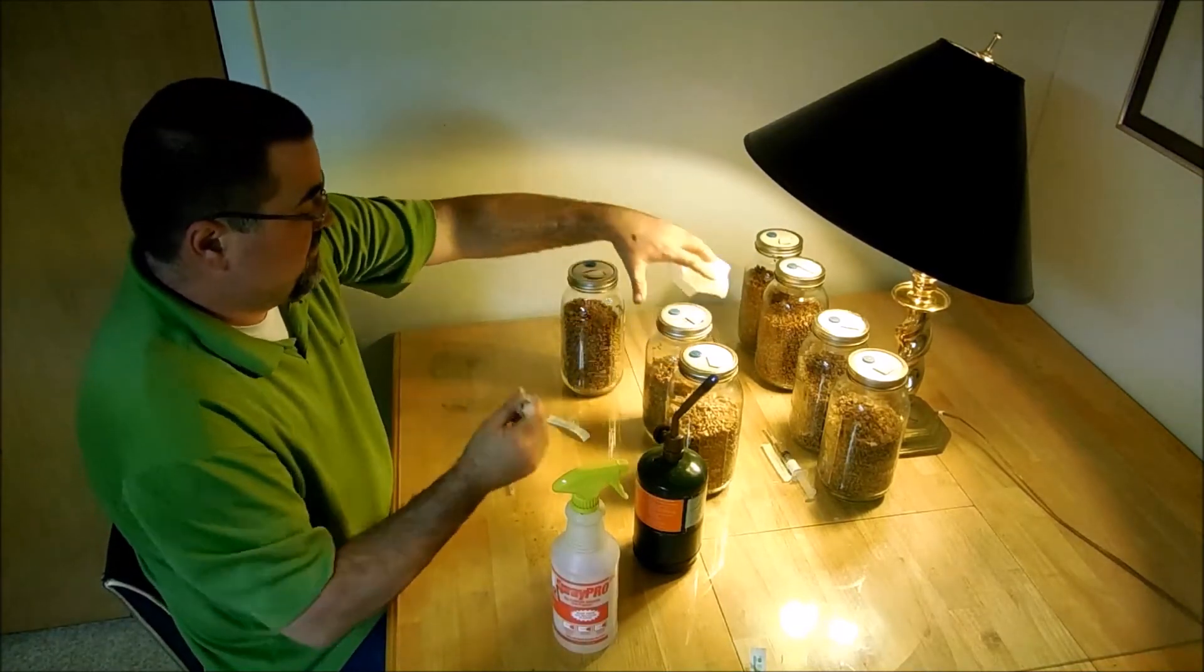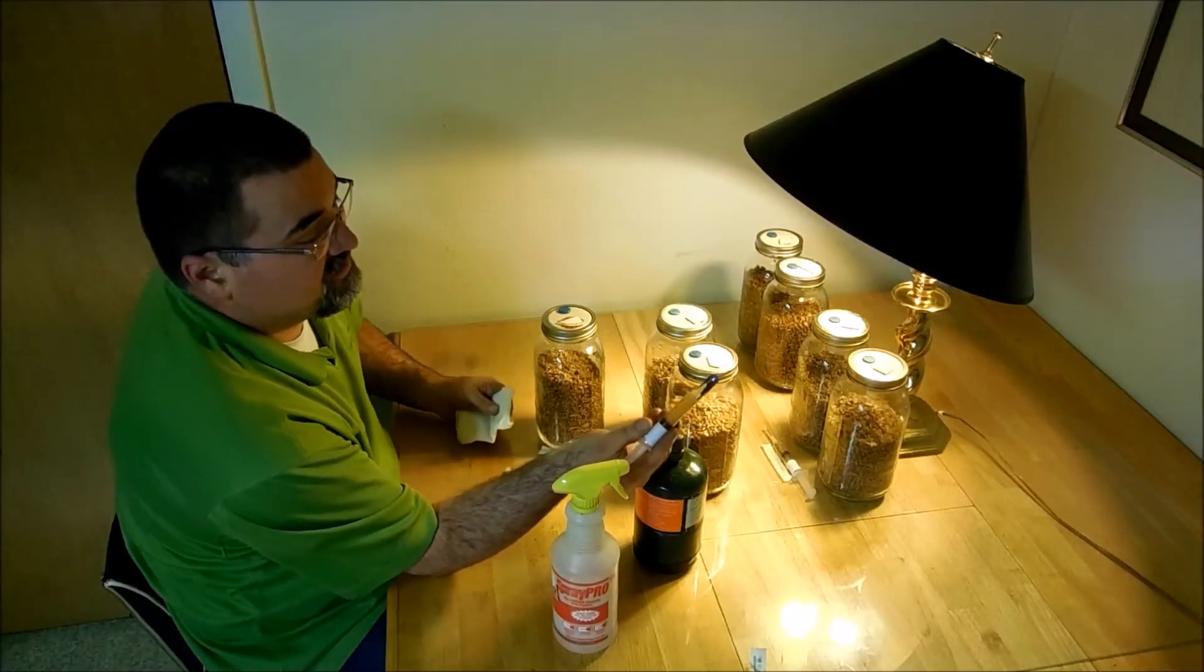Maybe I should have used more. So this one here I'm going to put four cc's in, see if it makes any difference.